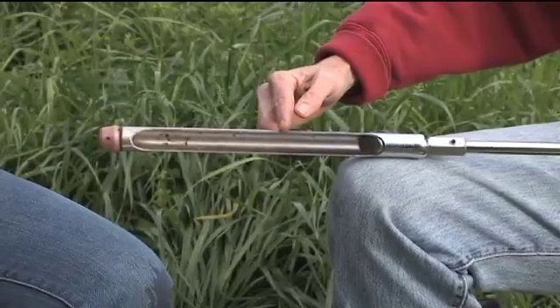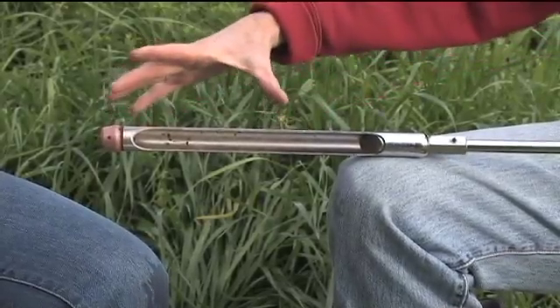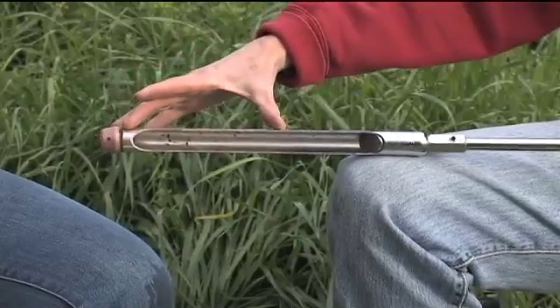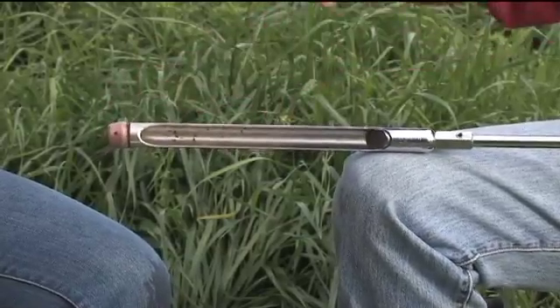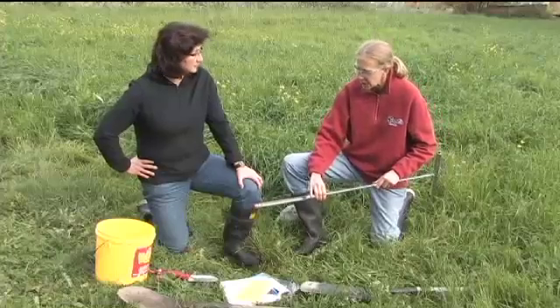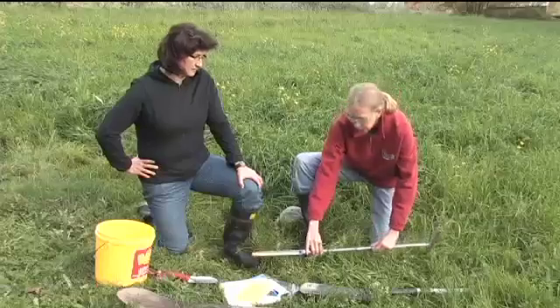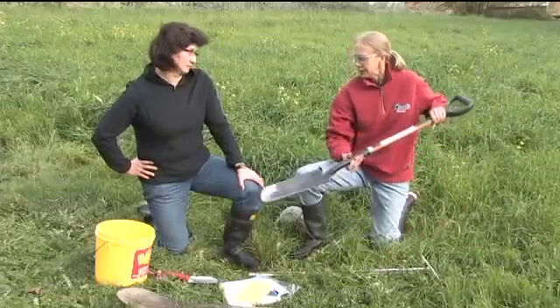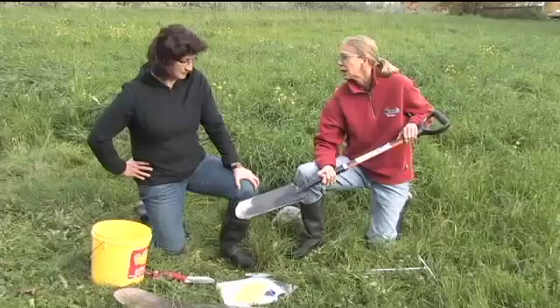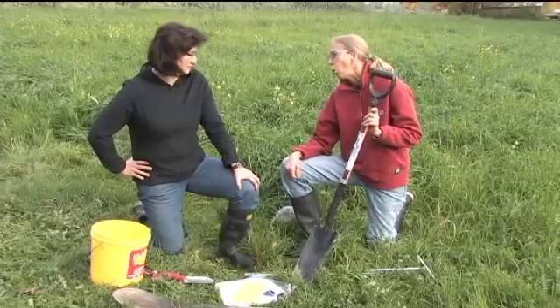There's a mark on the side at 15 centimeters — that's our rooting depth. So we can get samples quickly from various sites in the field and composite them together to build our soil sample. If we've got a site like a forest site where there are more roots or rocks, we may have to go to a shovel. This is a nice narrow type of shovel because we can dig quite deep without digging a big hole.